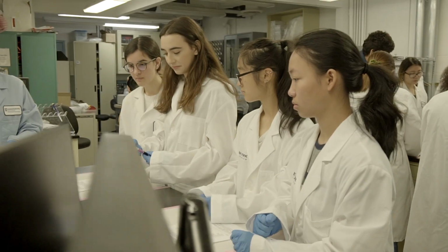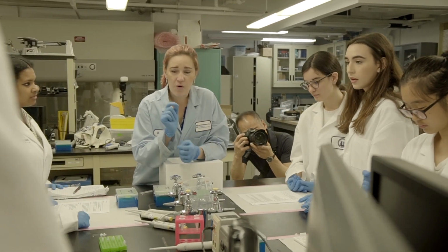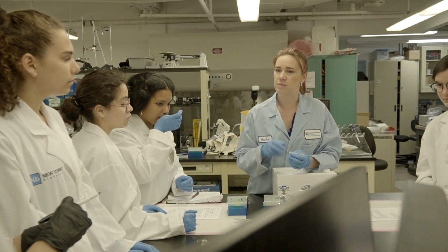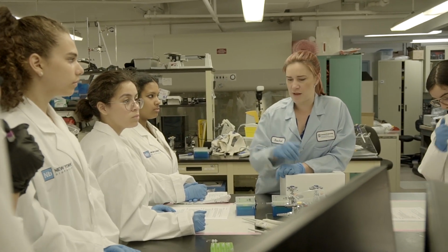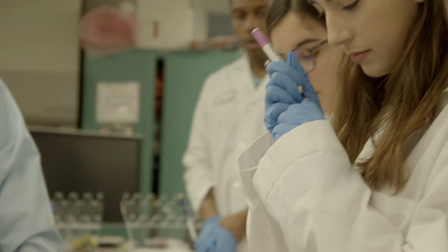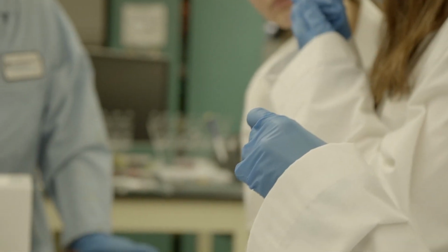An X? Okay, perfect. So you want to label the top of your tube with your letter. Also, whoever thinks they can write the smallest in your group, on the side of the tube write up high PCR, because we're going to end up with 2 different tubes so we can keep track of it. You can write PCR and your X or your letter as well, just so we can identify whose tube is whose. The other one is going to be for the restriction digest, so we can label that one later.